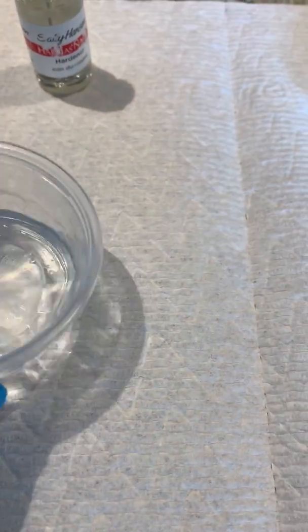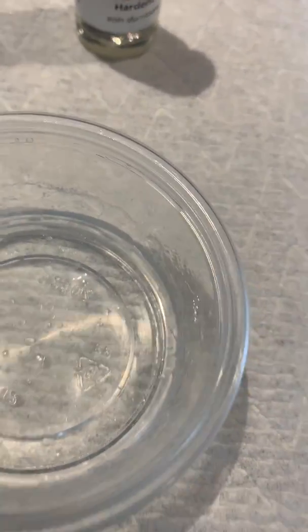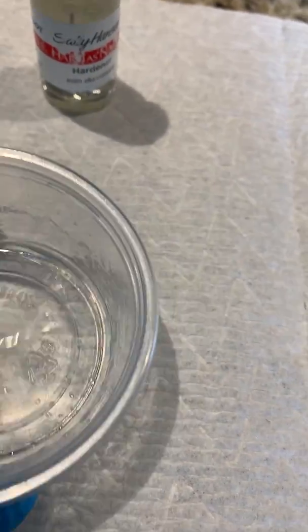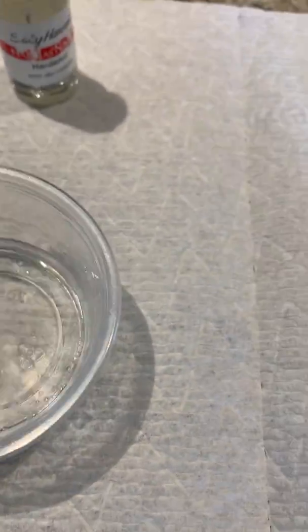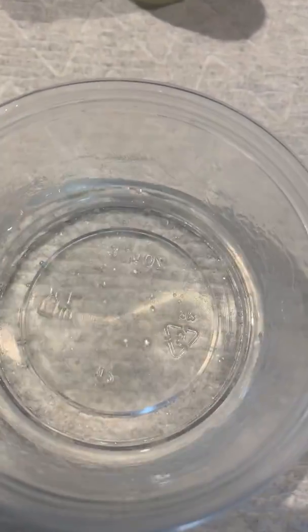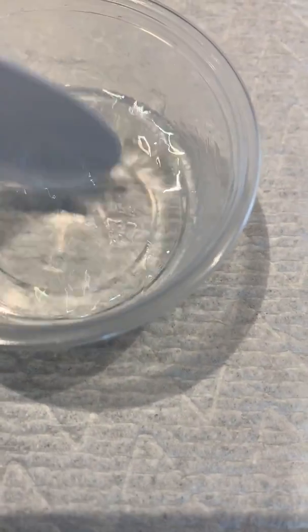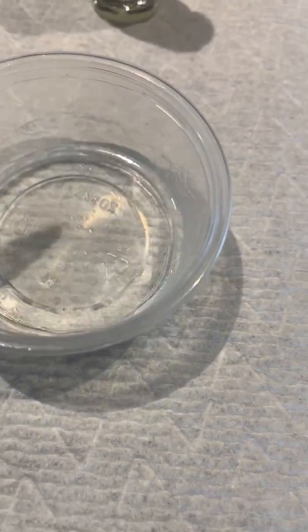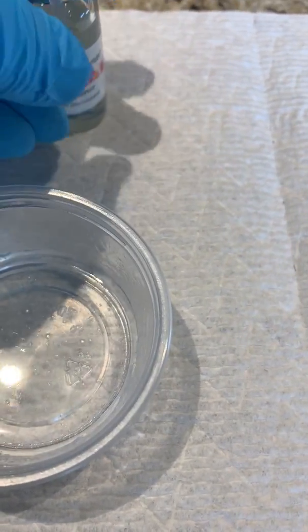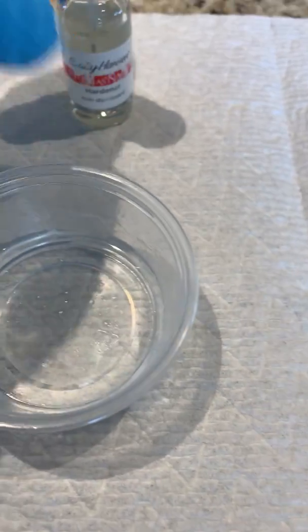But what you have here is the mixture of this. Now you'll start to see, if you can look, some of the deposition of the acrylic acid actually on the plastic — that will be the material that isn't able to stay in solution. But you can see that the acrylic acid is not forming clumps; those are just the bubbles here. They are remaining in solution, and so this is a very clear example that both acrylic acid and water, being both polar and having hydrogen bonding capabilities, are able to mix together.